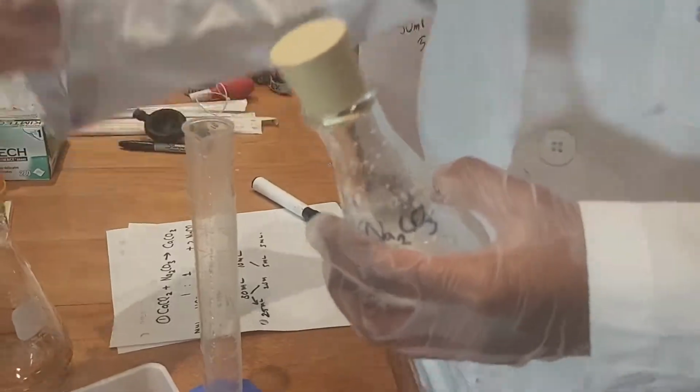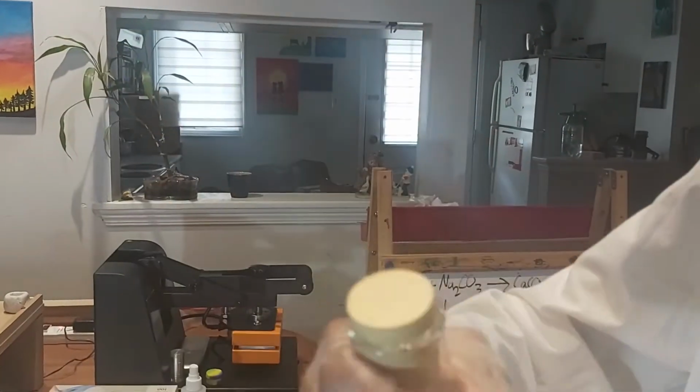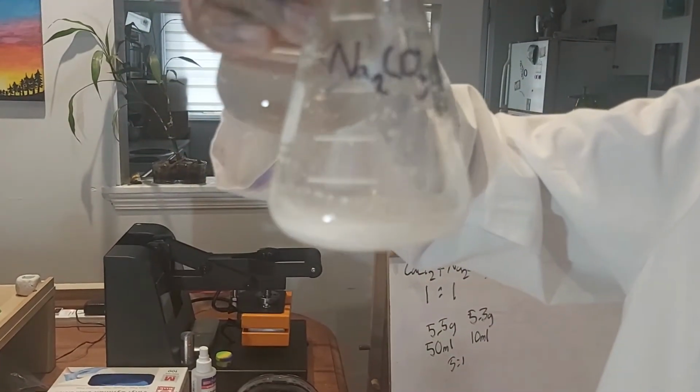There you have it. You have both the calcium chloride solution and the sodium carbonate solution.